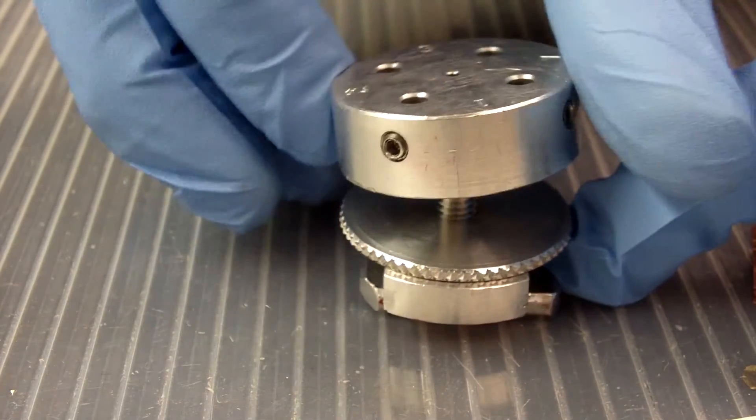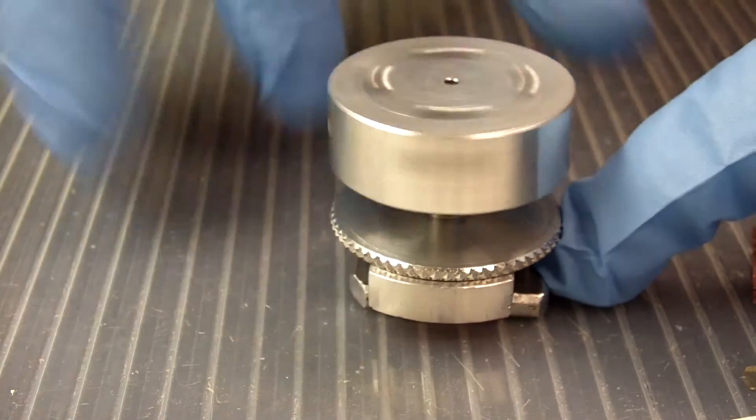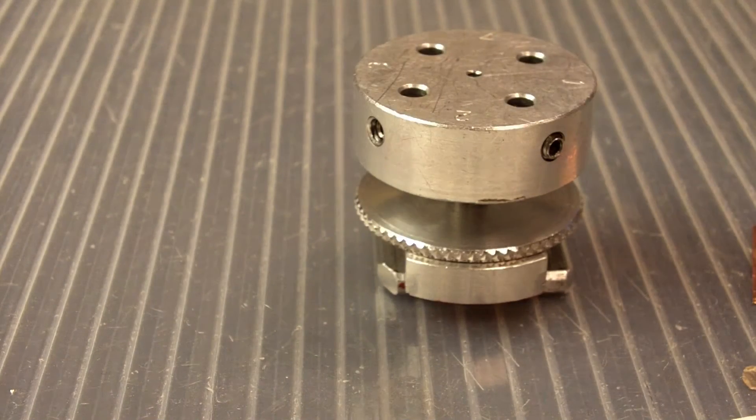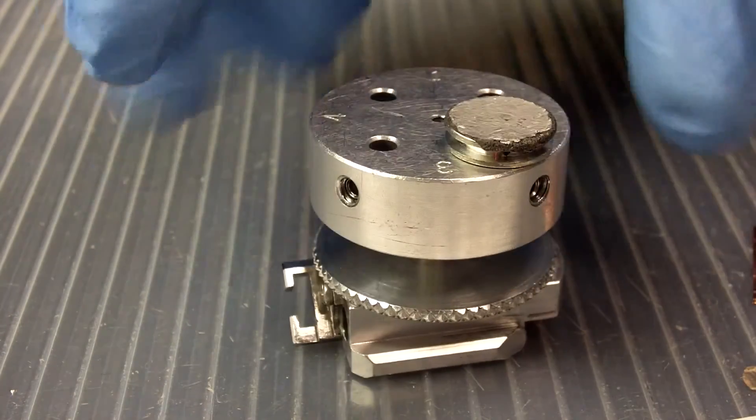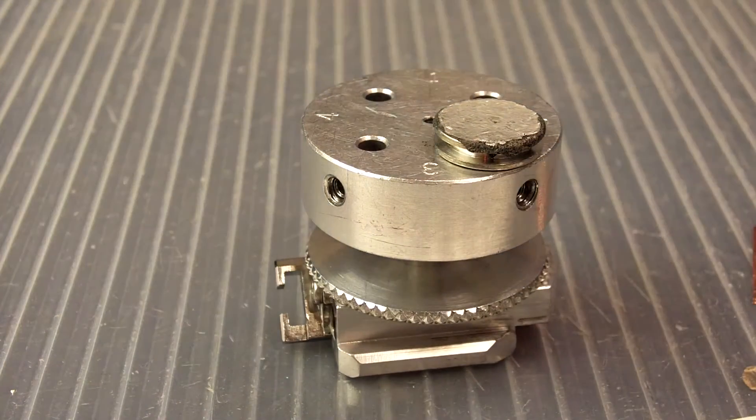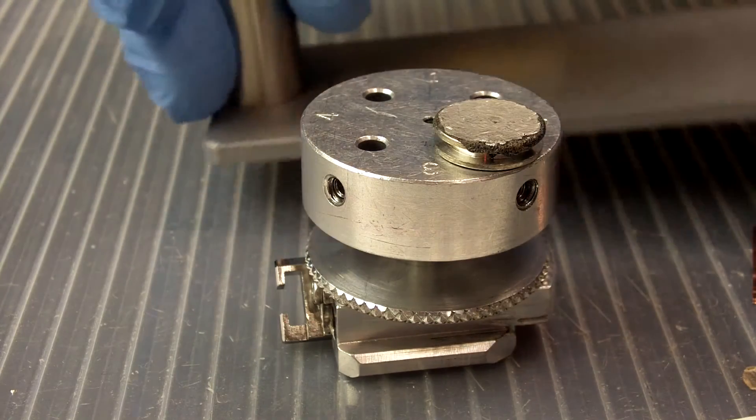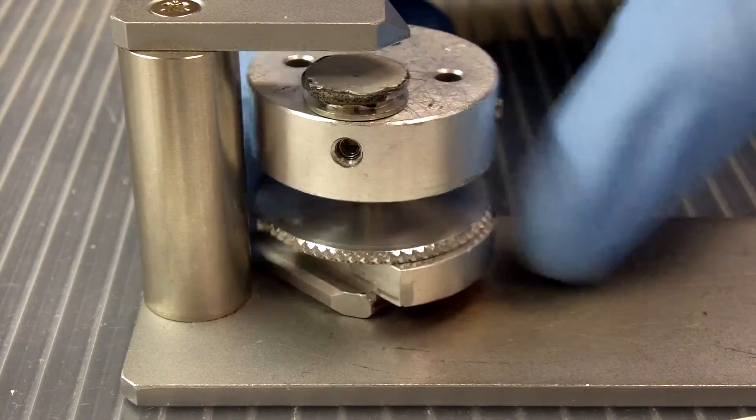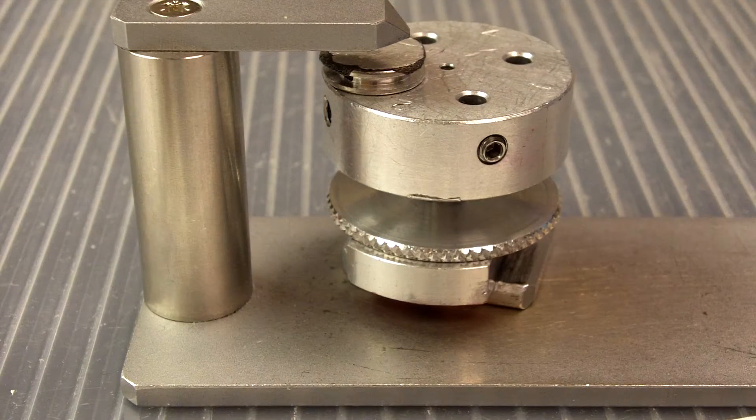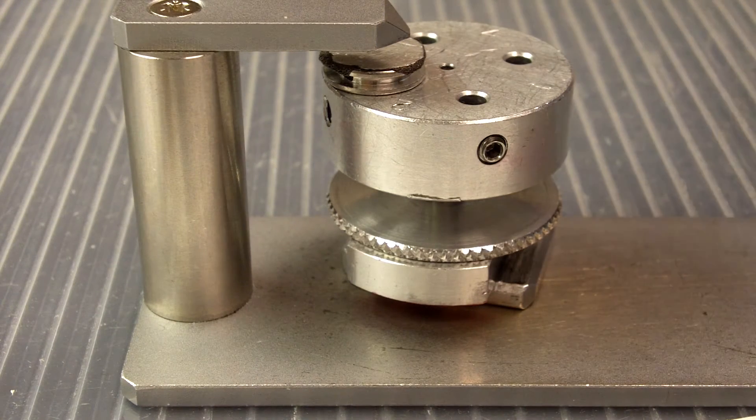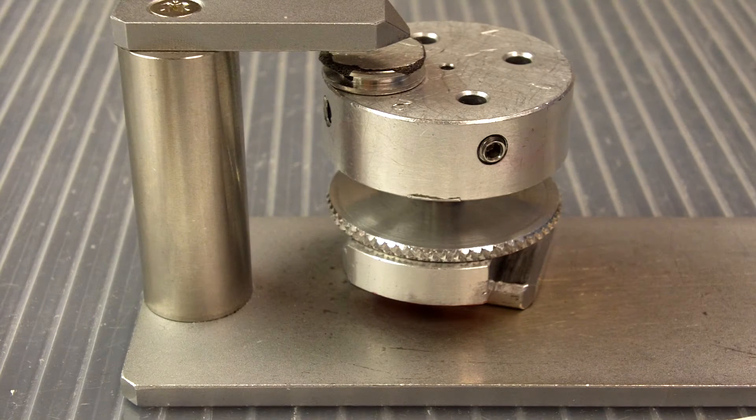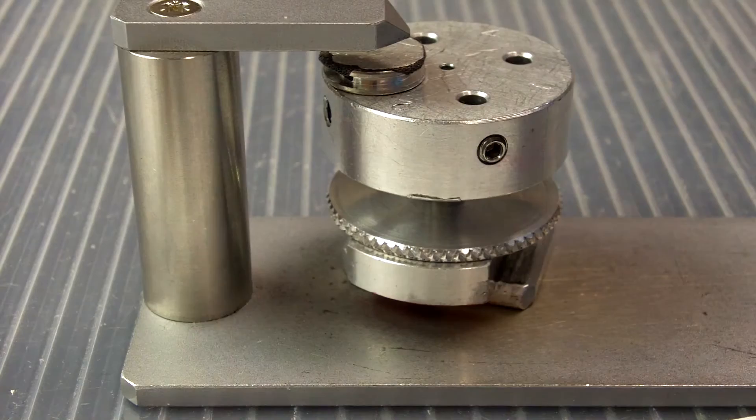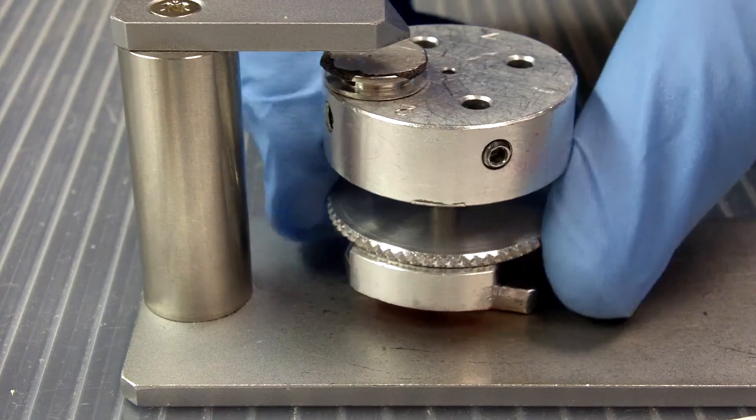Lastly, I'm going to put our platform thing here on the top. Easy. Now I put a sample on the platform, tighten down the set screw here, and then check to make sure that everything fit here underneath the height gauge. Just like that. Now this part with the height gauge is not optional. And it is 100% mandatory 100% of the time you use the SEM.